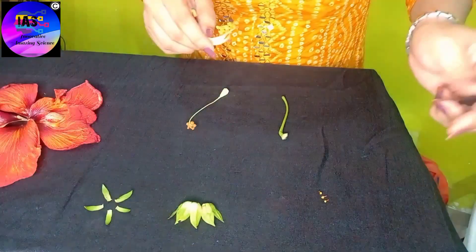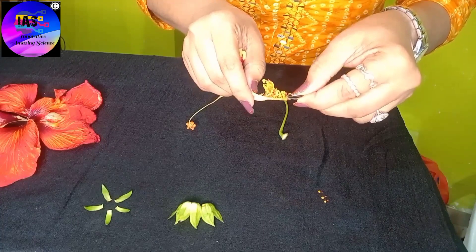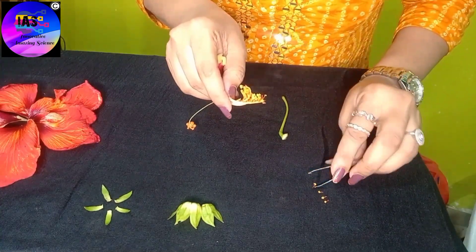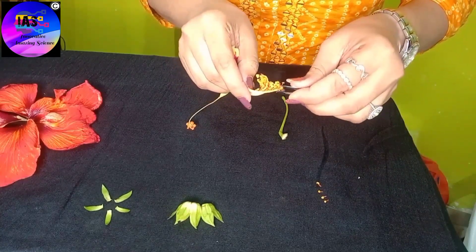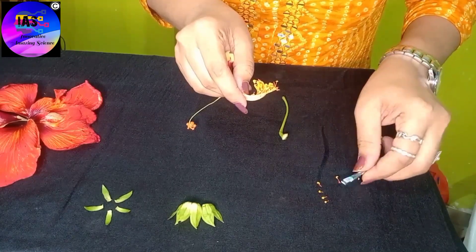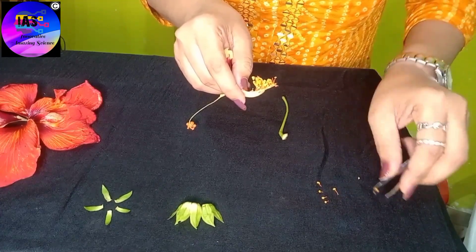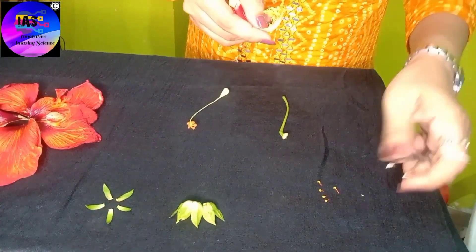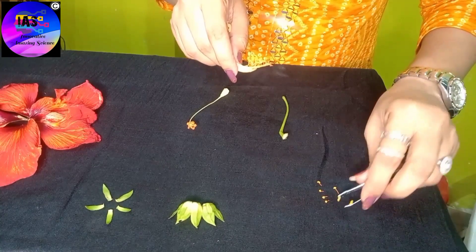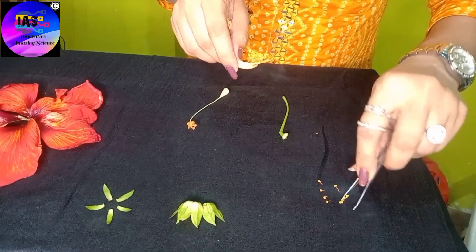You can see that I'm holding the staminal tube, which is the third whorl of a flower known as the androecium, and it contains the collection of stamens. Using a tweezer, I am going to separate each stamen. If you carefully observe, you can see the anther and the filament. The anther is present at the tip of the stamen, and it produces dust-like particles known as pollen grains. The stamen is the male reproductive unit of the flower.